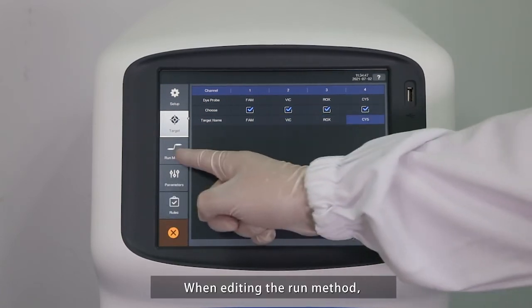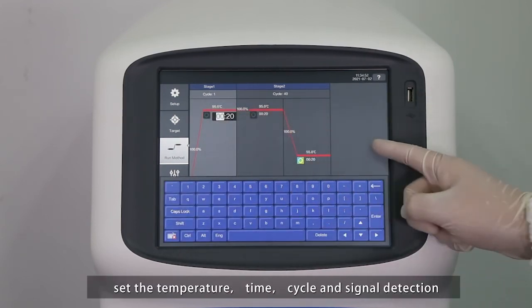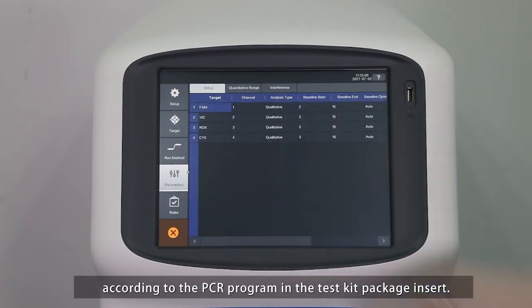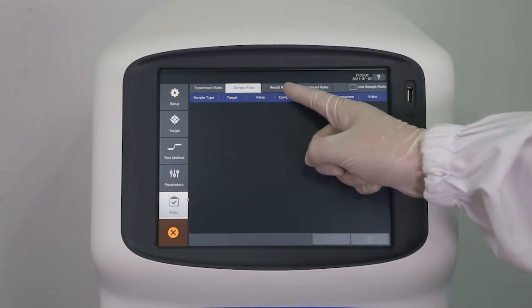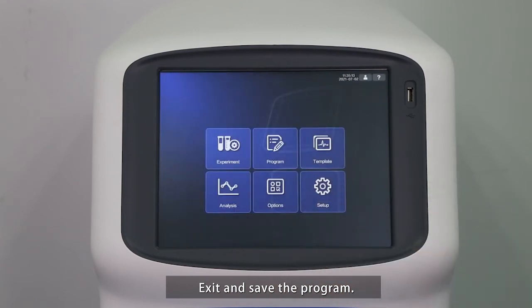When editing the run method, insert stages or steps. Set the temperature, time, cycle, and signal detection according to the PCR program in the test kit package insert. Exit and save the program.